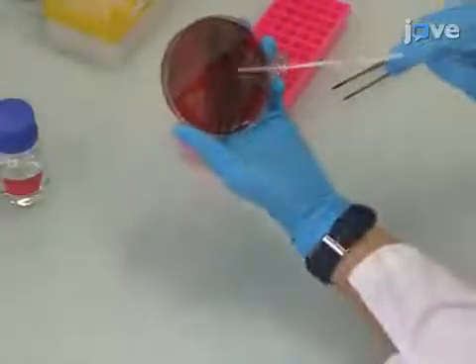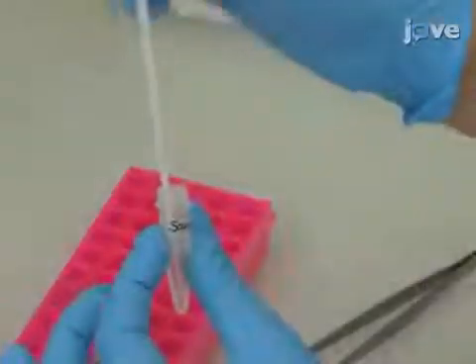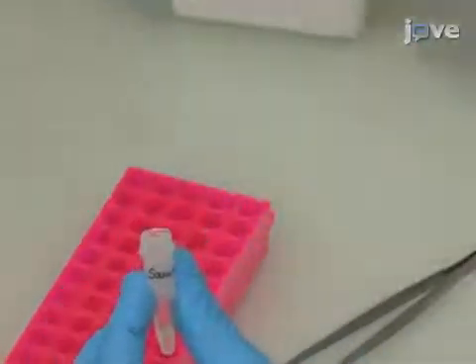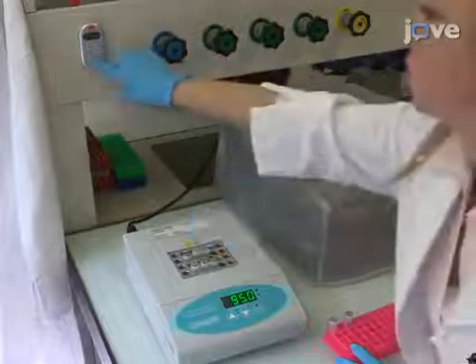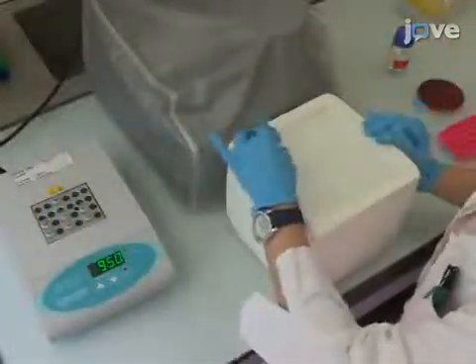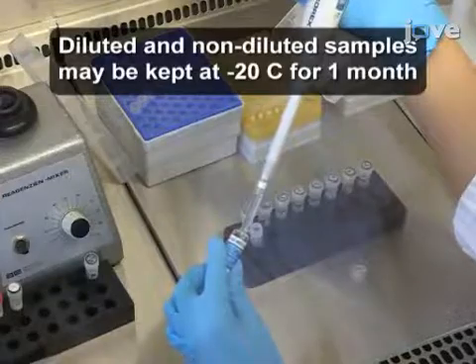Use a sterile plastic loop or wooden toothpick to collect one bacterial colony from a BA agar plate and resuspend it in 100 microliters of TEL in a 1.5 milliliter screw cap tube. Incubate the samples at 95 degrees Celsius for 10 minutes and immediately place them on wet ice. Then dilute the samples 1 to 100 in water suitable for PCR.